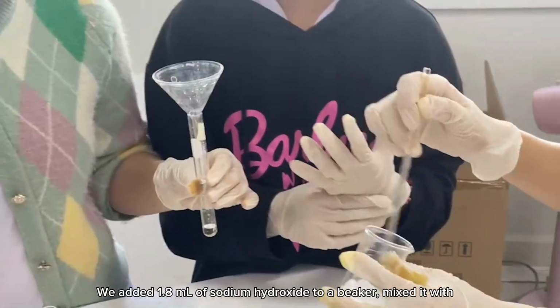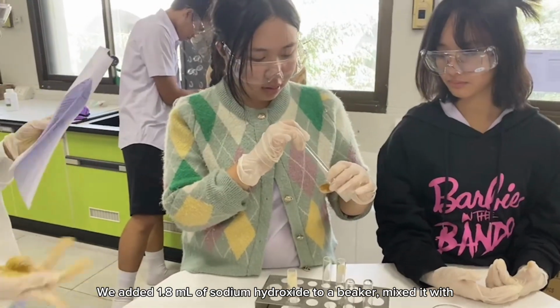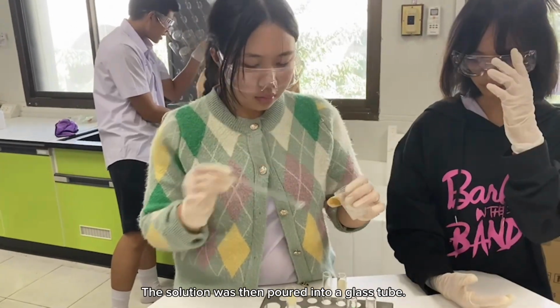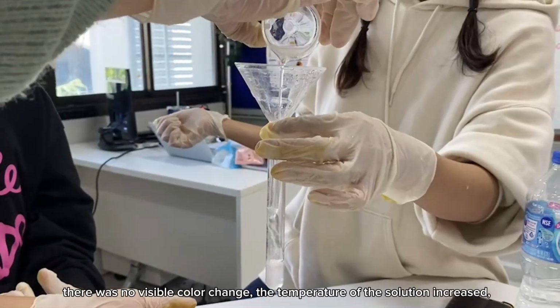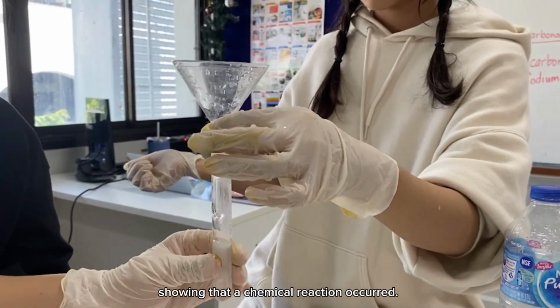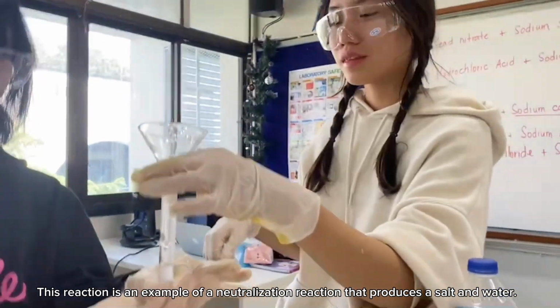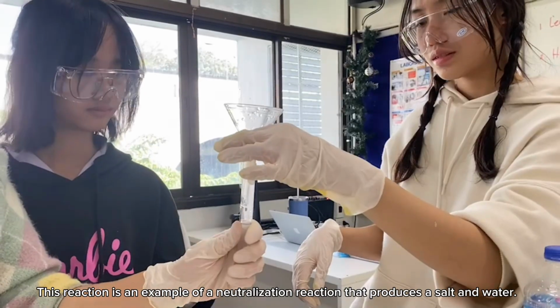We added 1.8 milliliters of sodium hydroxide to a beaker, mixed it with a small amount of water, and stirred it. The solution was then poured into a glass tube. There was no visible color change. The temperature of the solution increased, showing that a chemical reaction occurred. This reaction is an example of a neutralization reaction that produces a salt and water.